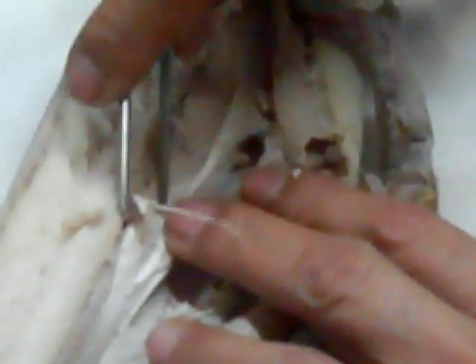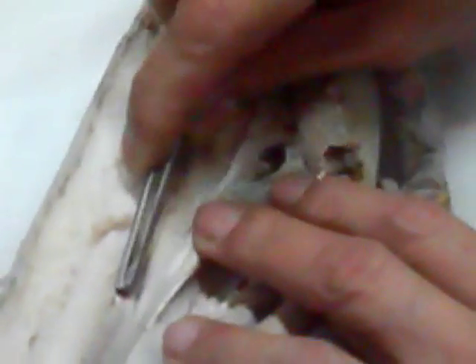So be very careful in removing this. You might be cutting some delicate parts. Remove the parietal peritoneum little by little, so be careful.